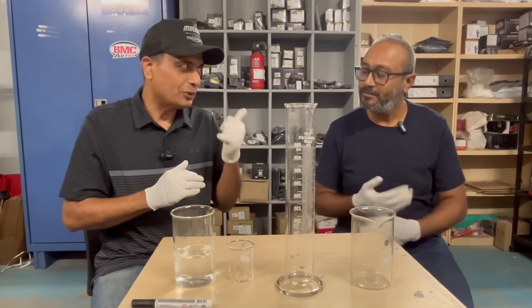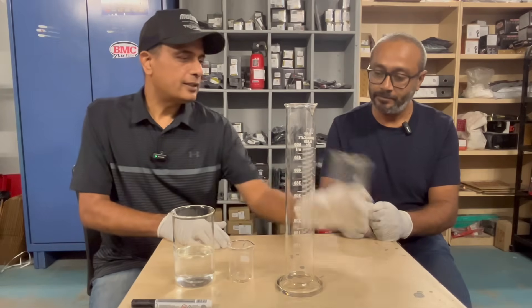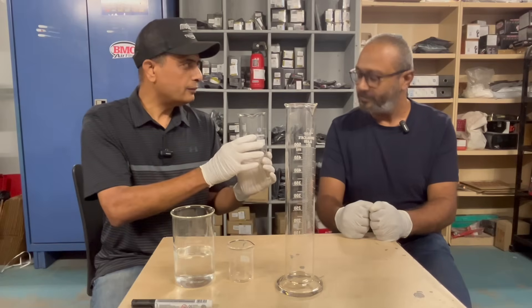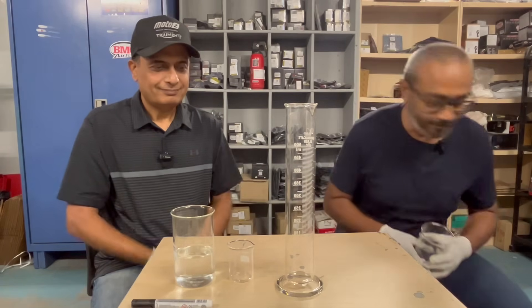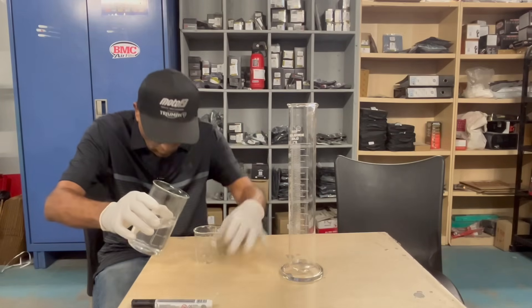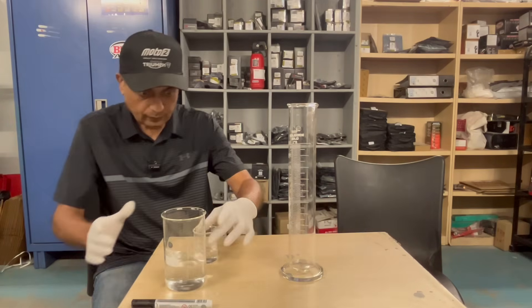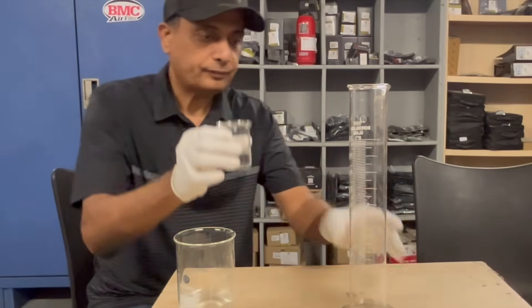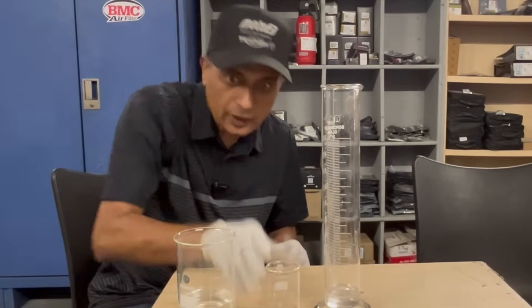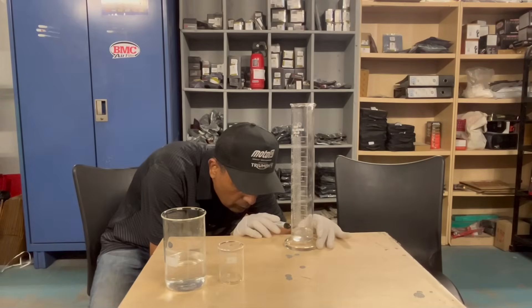We want to know the hydrophilic properties of ethanol. I would like you to take this cylinder and get me 400 ml of E10 petrol. While he's getting the petrol, let me set up 40 ml of water — this is just regular drinking water. That's 40 ml, put it into this measured cylinder, and I will mark it.